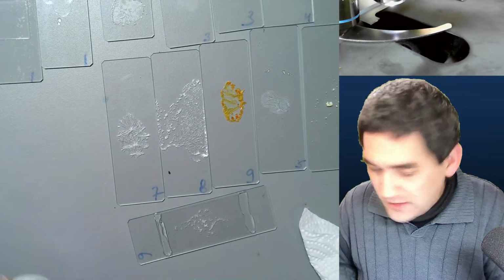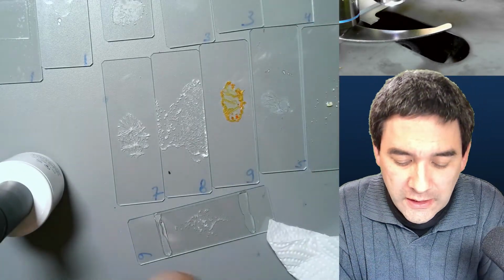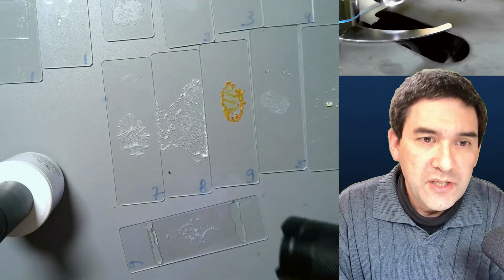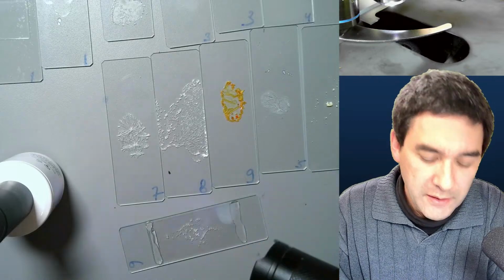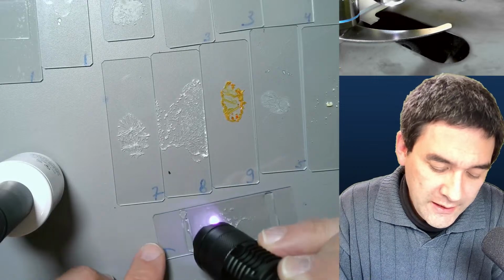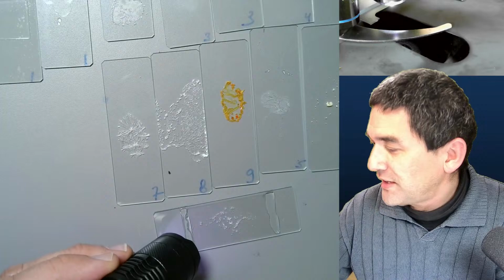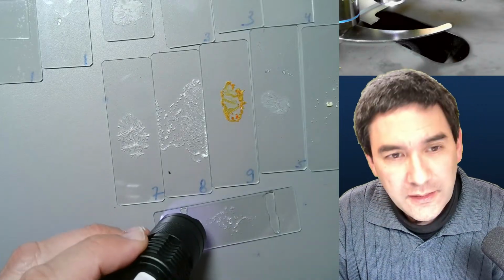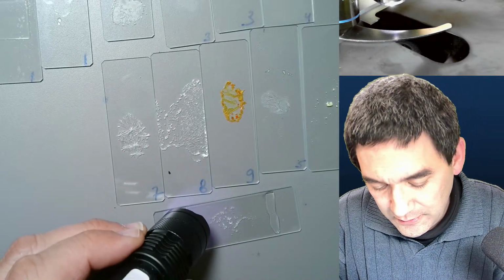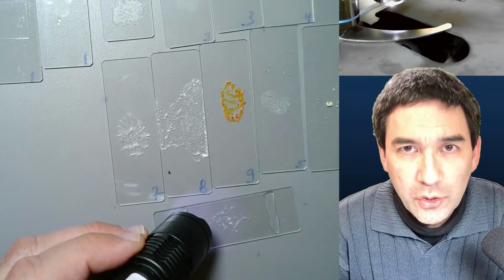And then what you need is an ultraviolet flashlight. This is a bluish light. And look what you have to do for 1 minute. I don't know, are you able to see this? Yeah, it's actually bluish in color. And for 1 minute, you have to shine the blue UV light on this nail gel. Let me put this away just for safety reasons. And it says here, I think, 30 seconds to a minute. And this will actually cure the whole thing, and it will be turned relatively solid.